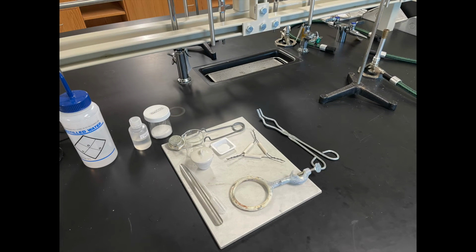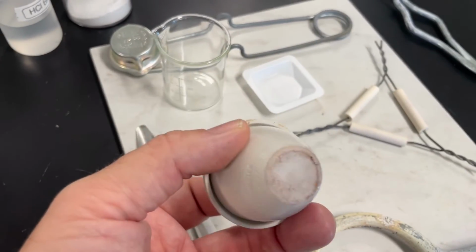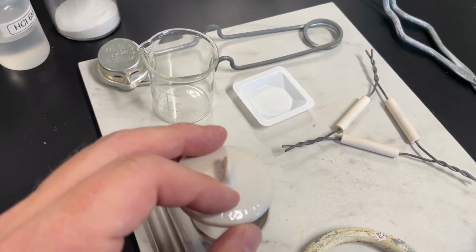So the first thing we're going to do is make sure that we have all the equipment that's listed as materials, and then we're going to give a very thorough check of our crucible for any cracks or deficiencies so that we can make sure we're not going to get injured or have any kind of breakage or spill during the heating process today.